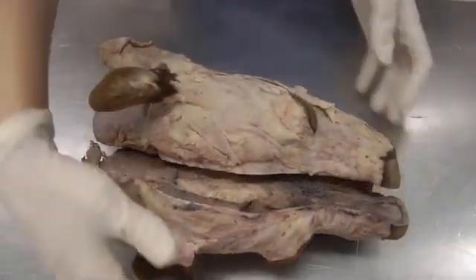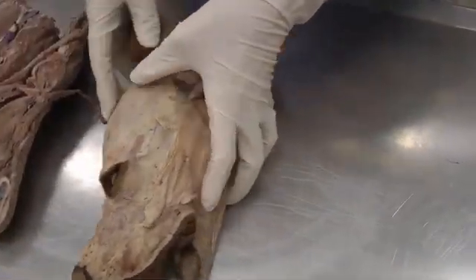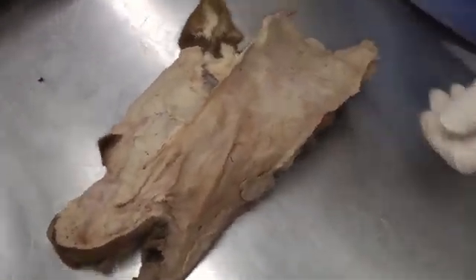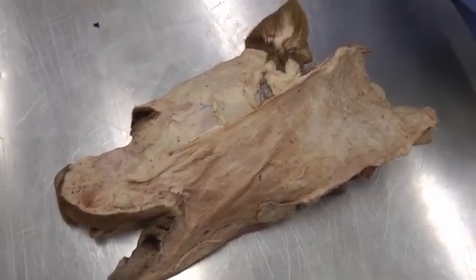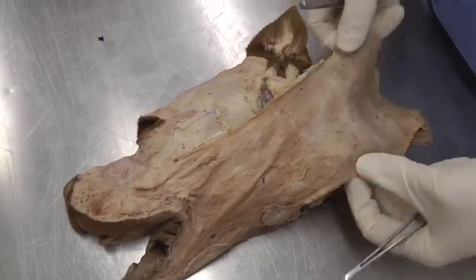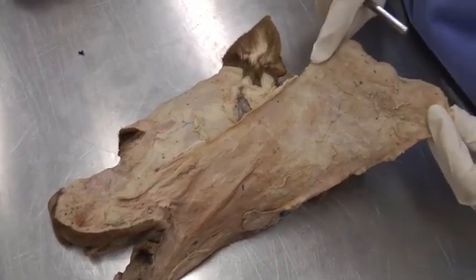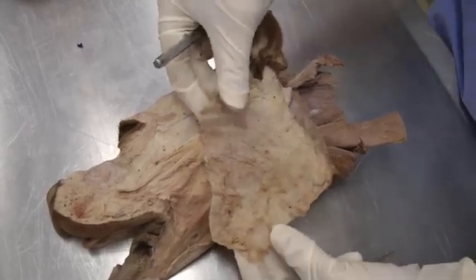We're going to work on the left side for muscles. Starting on the lateral side with the platysma muscle — we've seen this before in the neck. You're going to reflect it rostrally, toward the nose. Lift it up — it's this thin sheet of cutaneous muscle. That's the platysma.